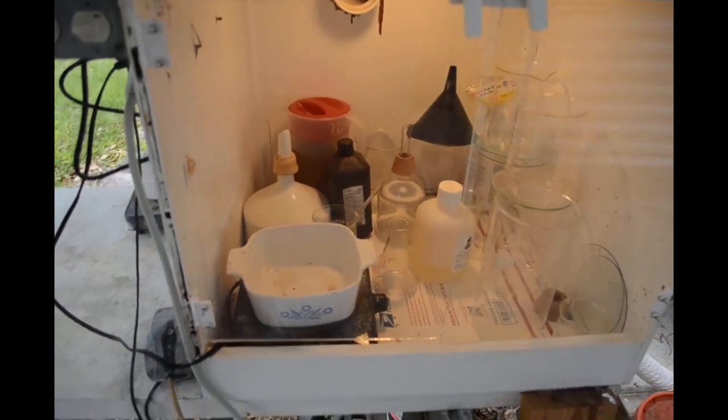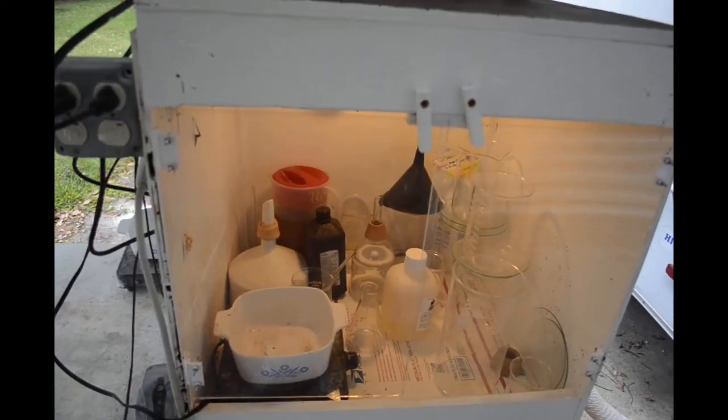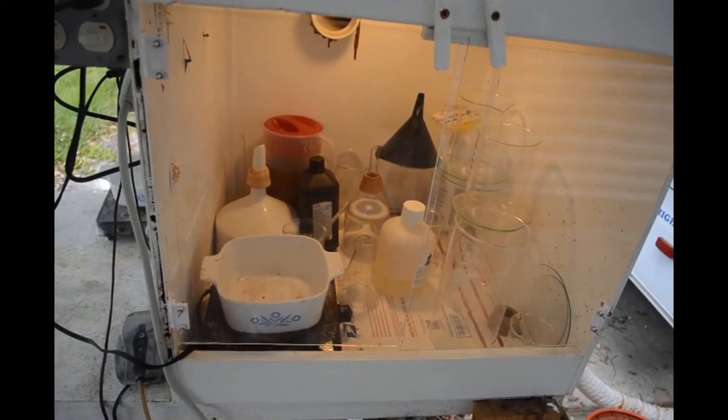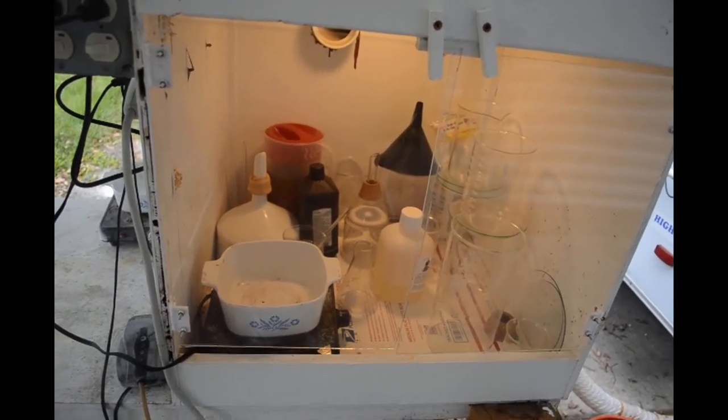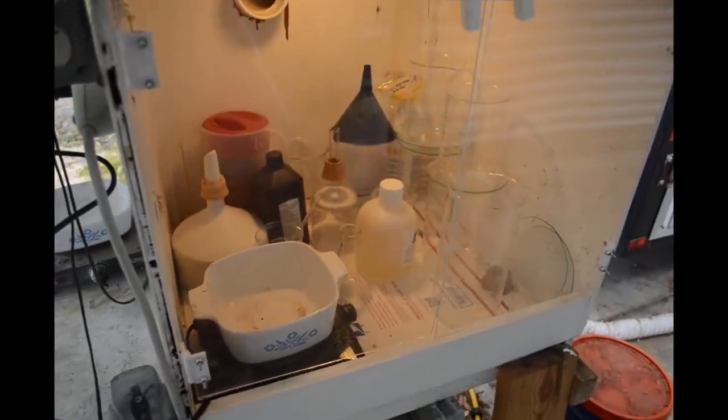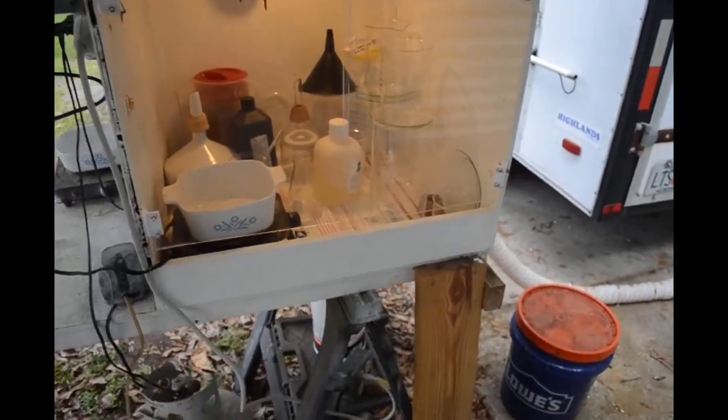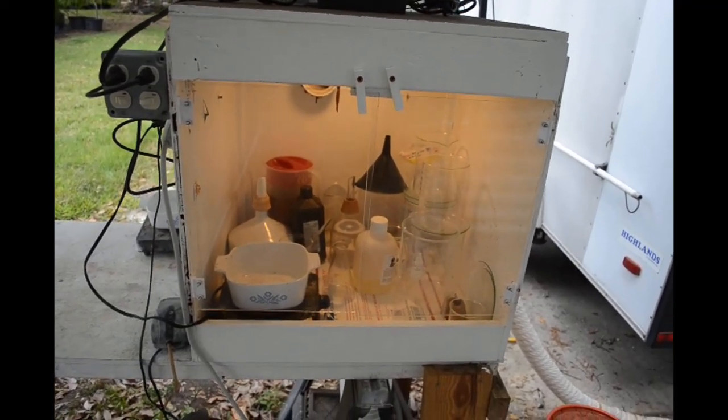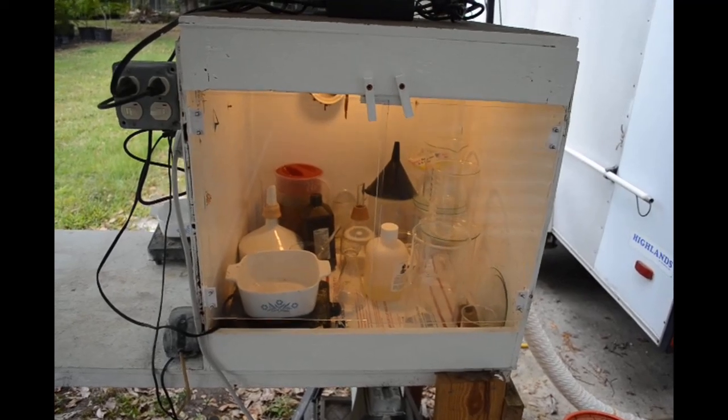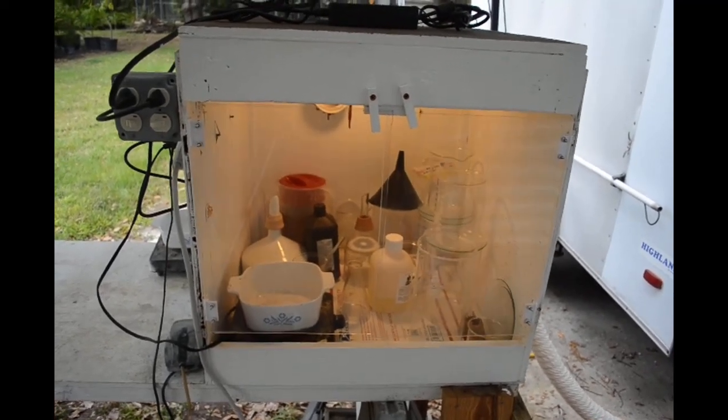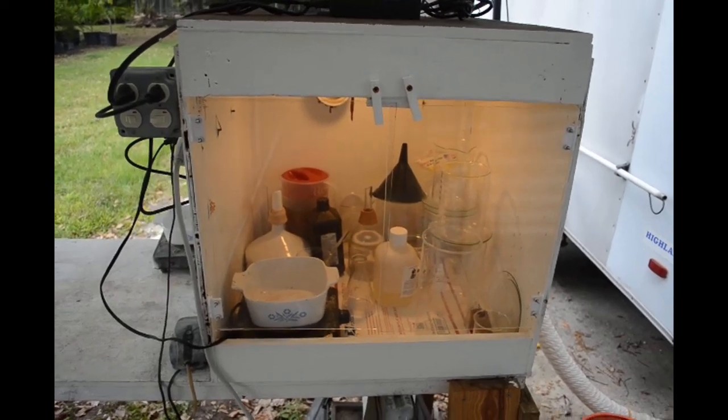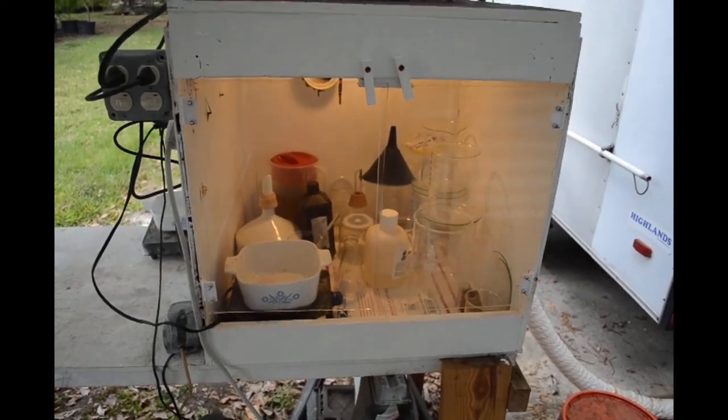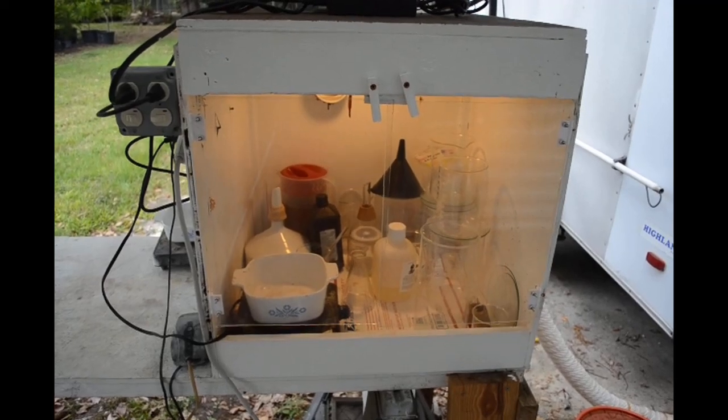That's just a quick little update. If you want to you can go back and look at my videos when I originally built this thing. I think I'm pretty much getting it right now. If anybody else wants a fume hood of their own, it really makes it convenient when you're working with acids like hydrochloric acid, nitric acid, to keep the fumes away from you because they are bad.